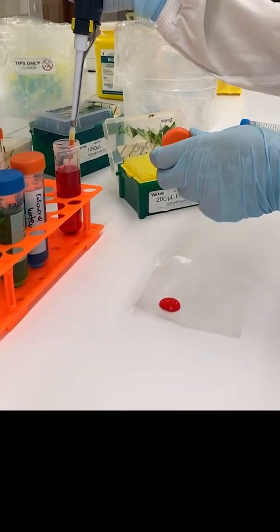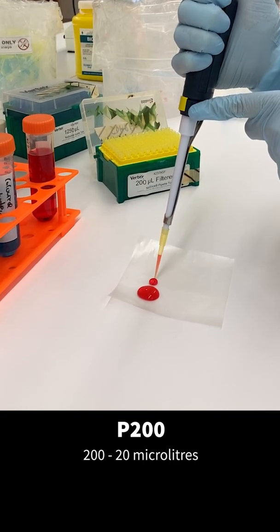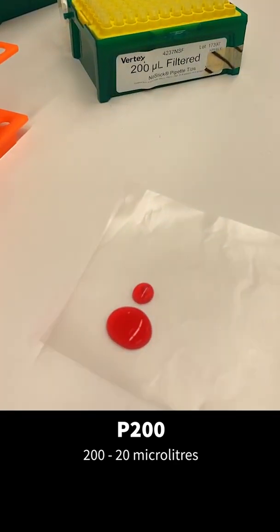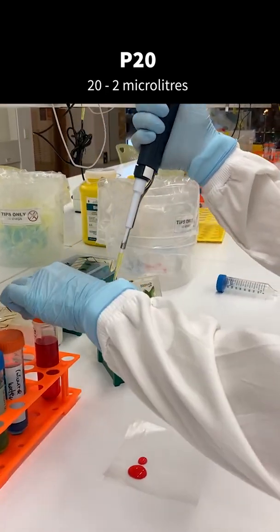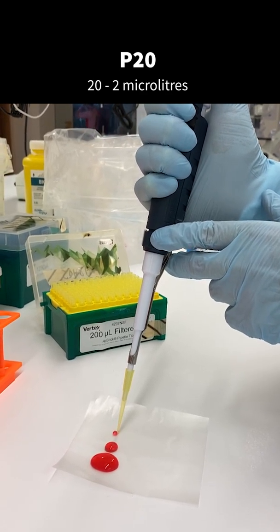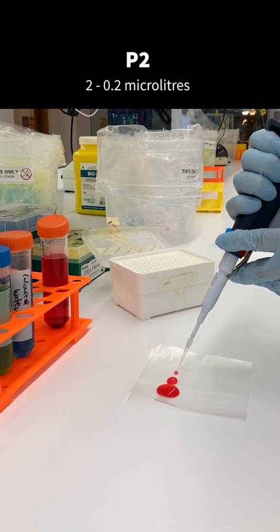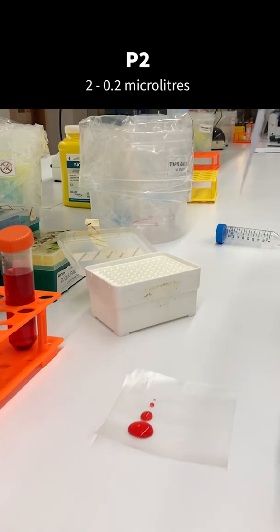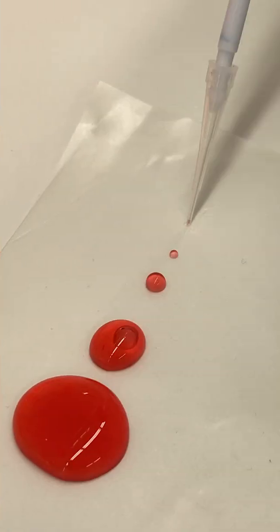Gilson pipettes also offer smaller volume ranges. A P200 pipette can measure a maximum volume of 200 microliters down to a minimum of 20 microliters. Next, a P20 pipette can measure a maximum of 20 microliters down to a minimum of 2 microliters. The smallest Gilson pipette can measure 2 microliters down to 0.2 microliters. That's like cutting a cubic centimetre block into 5,000 equally sized pieces and dispensing them.